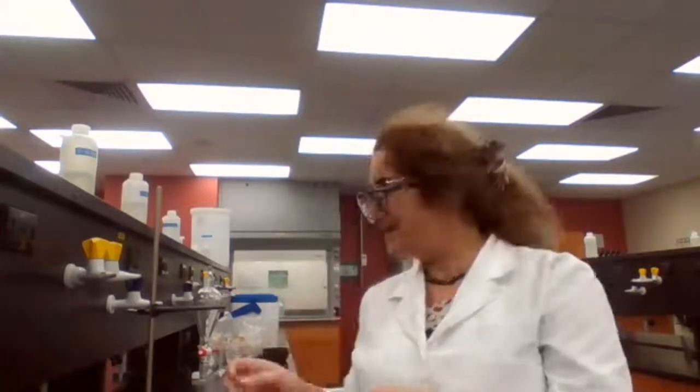And you are going to collect in the same flask 2 portions. So the first time you got 90% of the 100%. The second time you got 90% of the 10% left, which is 9%. Now you have like 99%. Well, I use the percentage as an example to make sure that you understand the preference of your compound to be more soluble in aqueous or more soluble in organic layer.